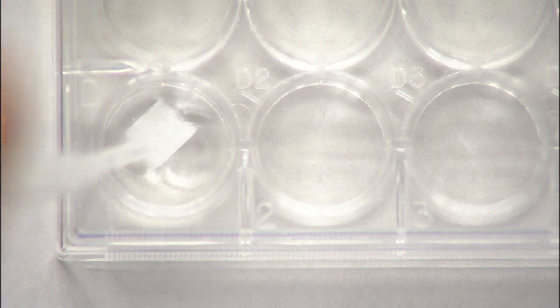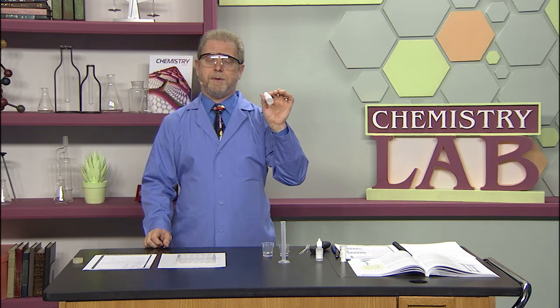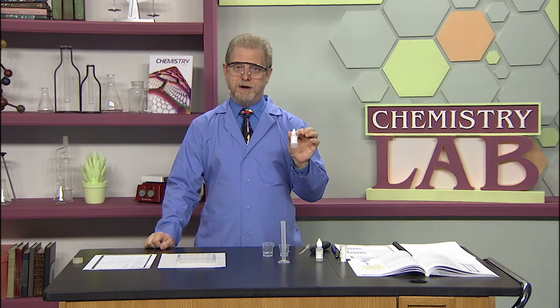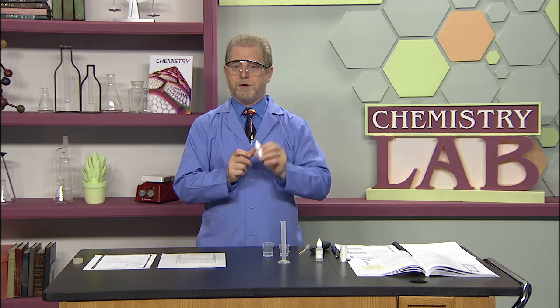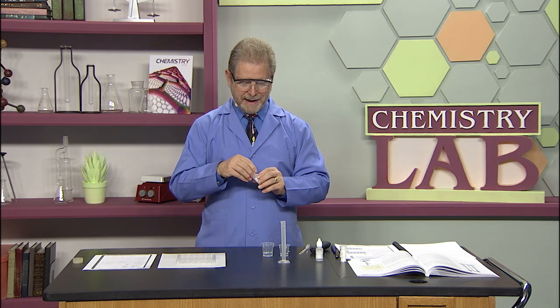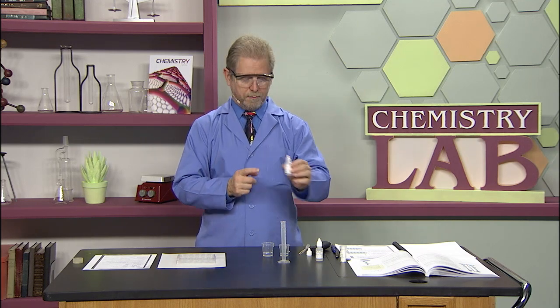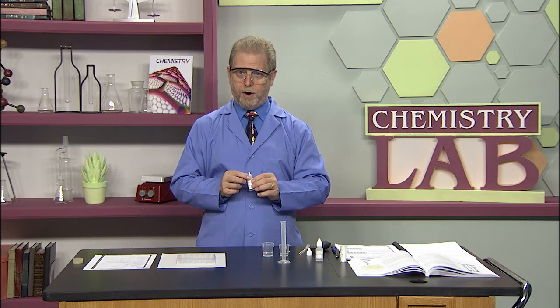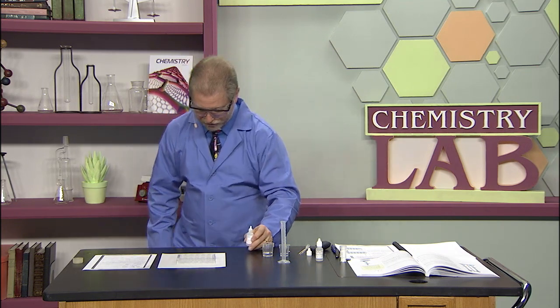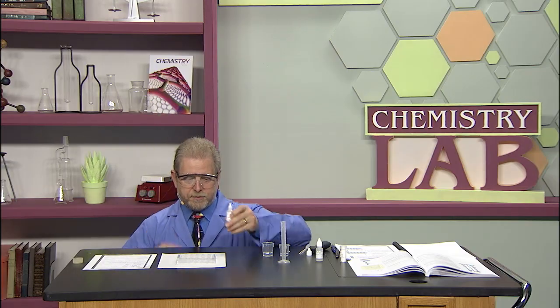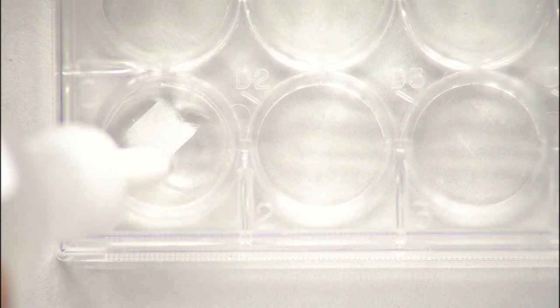To do the titration we take our potassium hydroxide, KOH, and it is at one tenth molar. We're assuming that this bottle has the same calibration as the distilled water, around 20. I'm going to start adding the KOH and counting the drops.